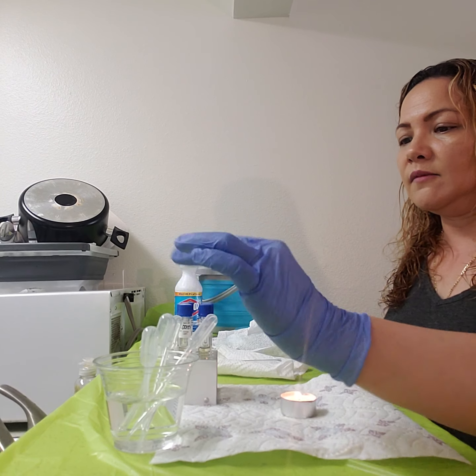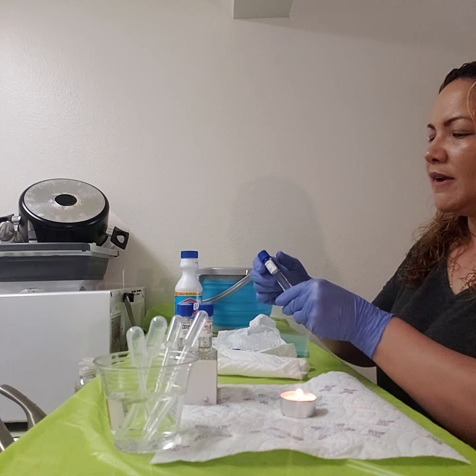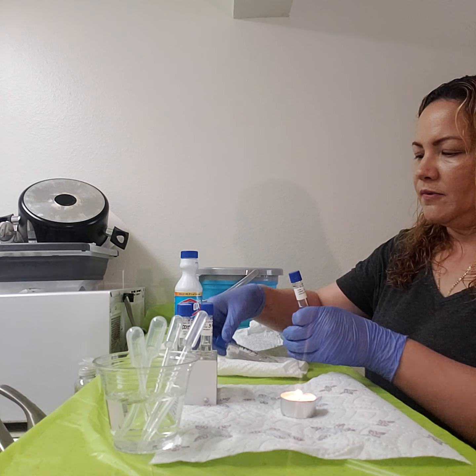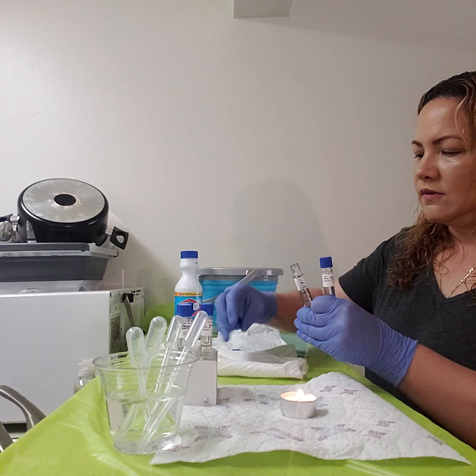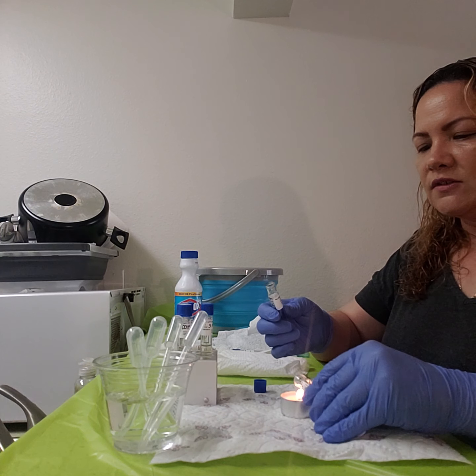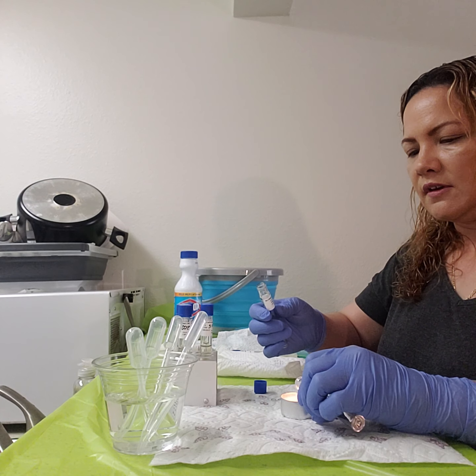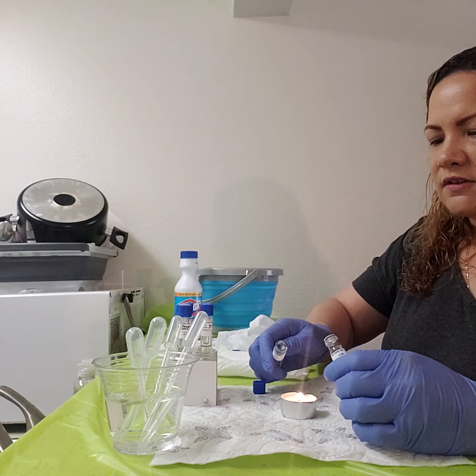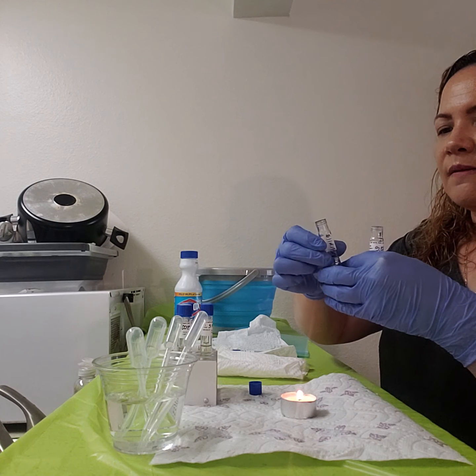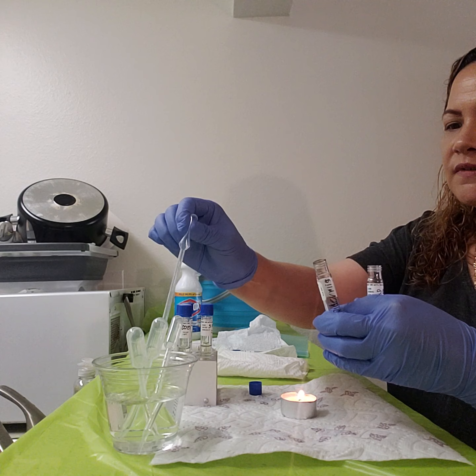Okay, and I'm continuing on now. I'm gonna start. So I have my S. epidermidis. I'm gonna do this quickly, and I need to go ahead and open them both. So leaving one lid here, and I'm gonna go ahead and do like I always do. We're going to sterilize the tip. Okay. And you just need to run it through the flame just for a little bit. And then I'm going to take the one that has the broth. Okay, and that only needs 2 drops.